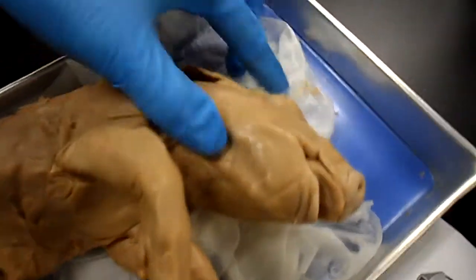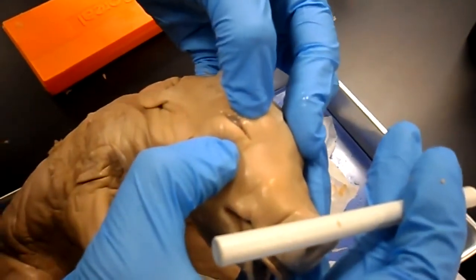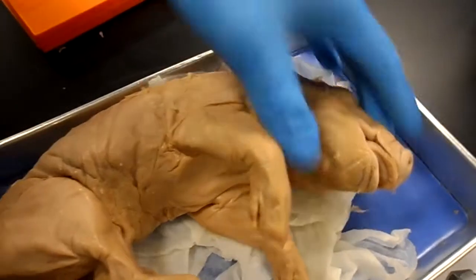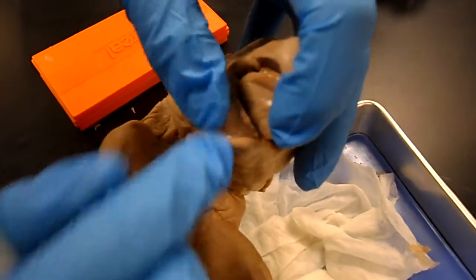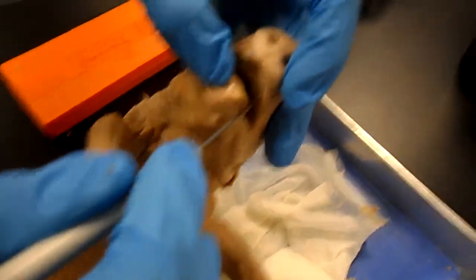The nictitating membrane is right there. The teeth: there are the incisors right there, and the canines are the sharp ones, like you can see right there.